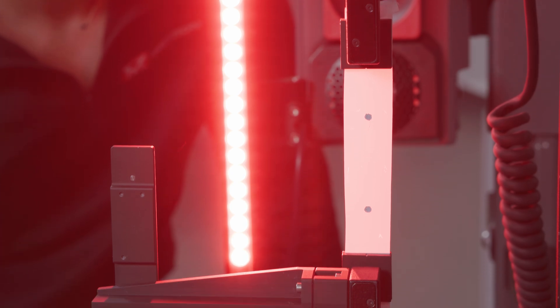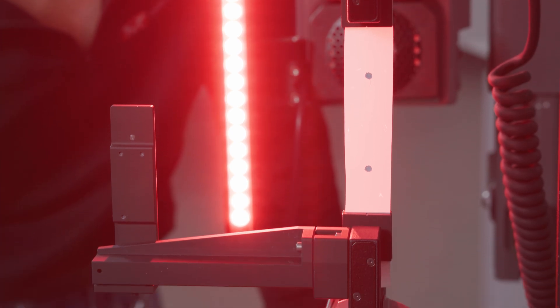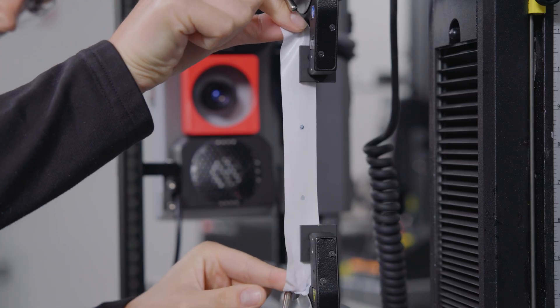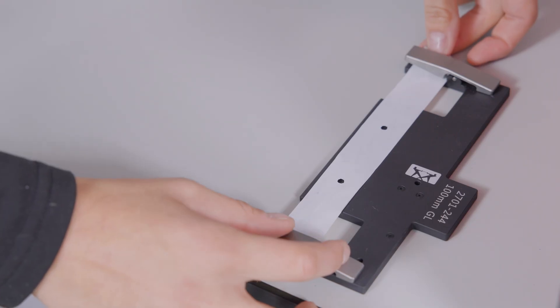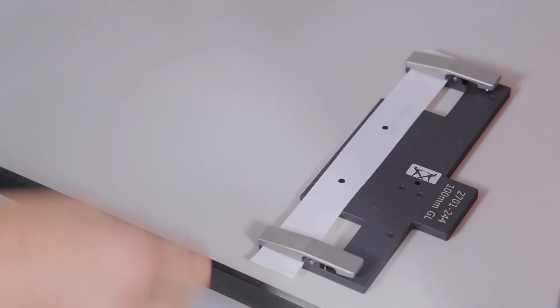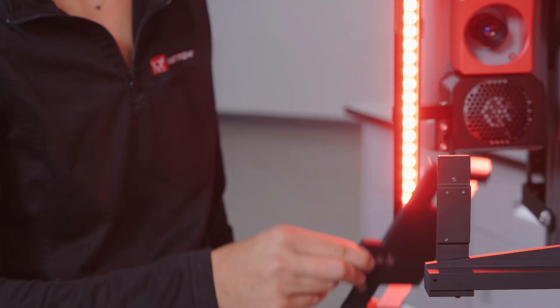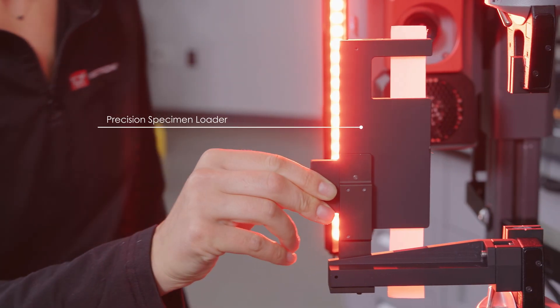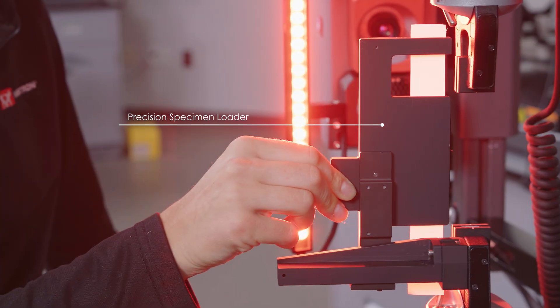Specimen alignment is critical and specimen reinsertion should be avoided. Repeatability and throughput can be improved by using an alignment and insertion device such as Instron's Precision Specimen Loader.